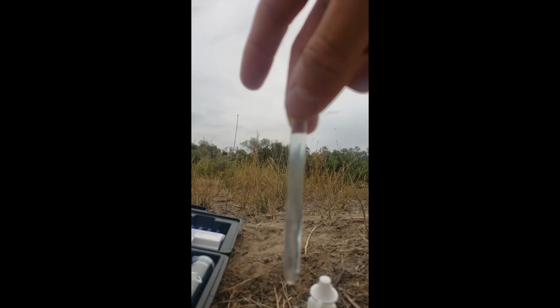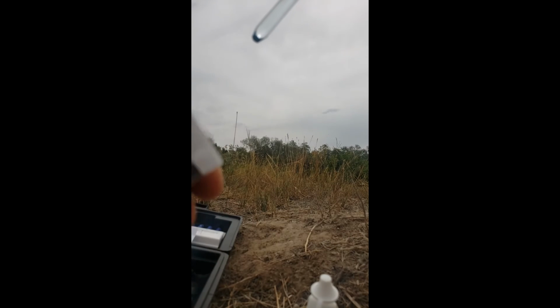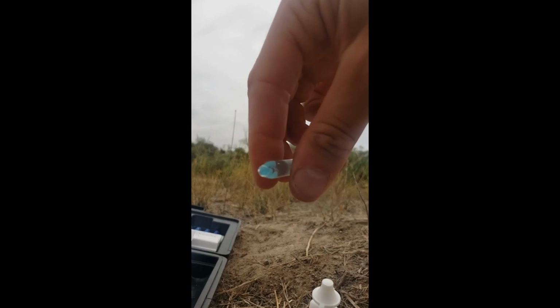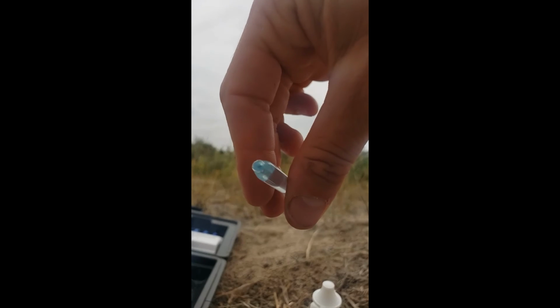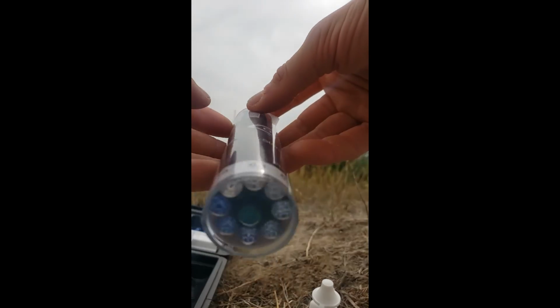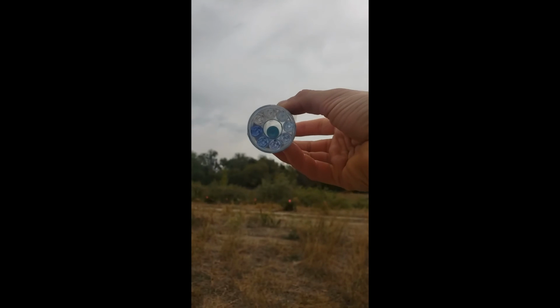Alright, you can still see this? Yes. And I'm going to put it in here, pop this lid off. Oh nope, I'm just going to put it in. Put it in like that. So the surface tension keeps the water from escaping. Those water molecules like to hold on to themselves better than they hold on to the surface of this glass so that they don't fall out. Okay, so I put it in and now I look to see.